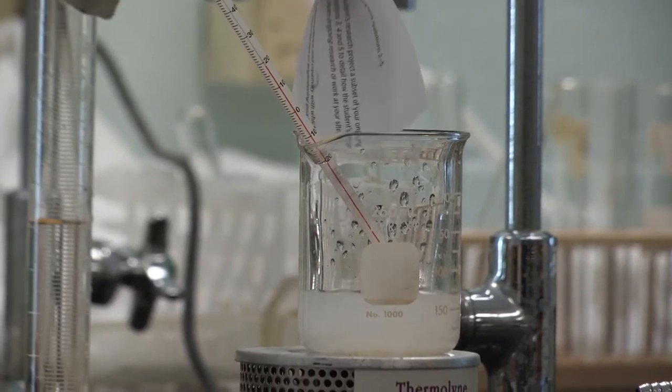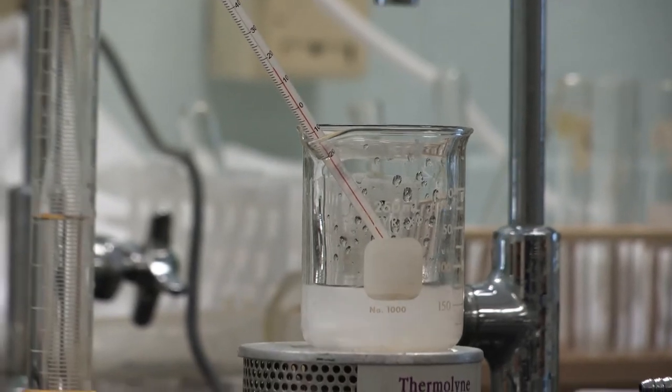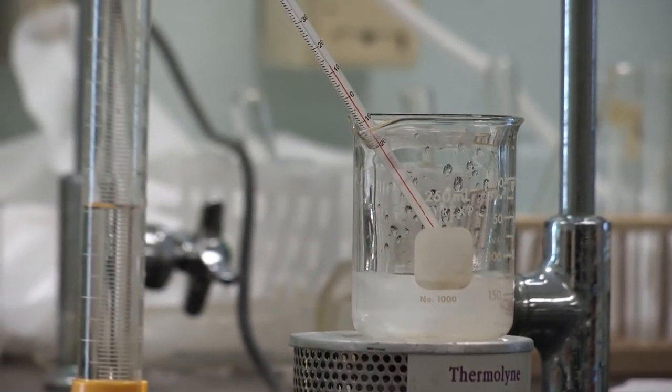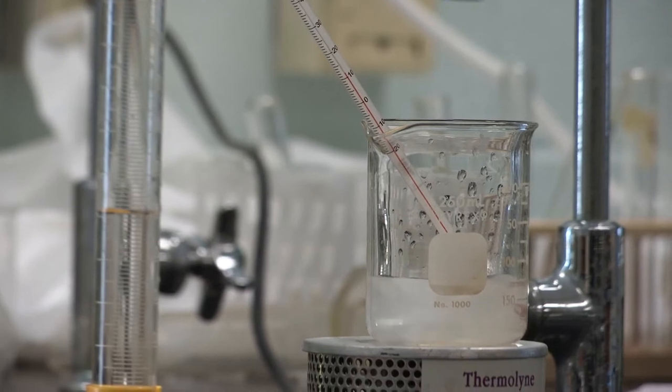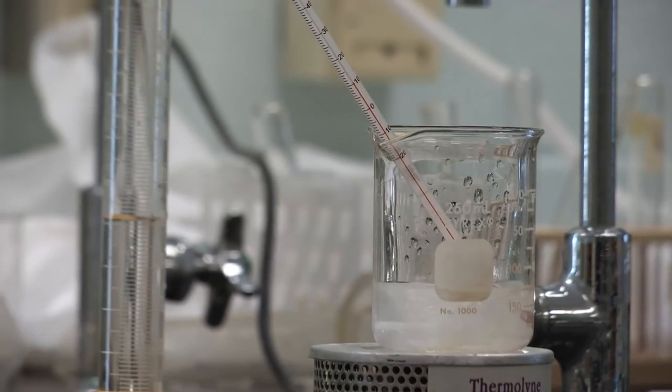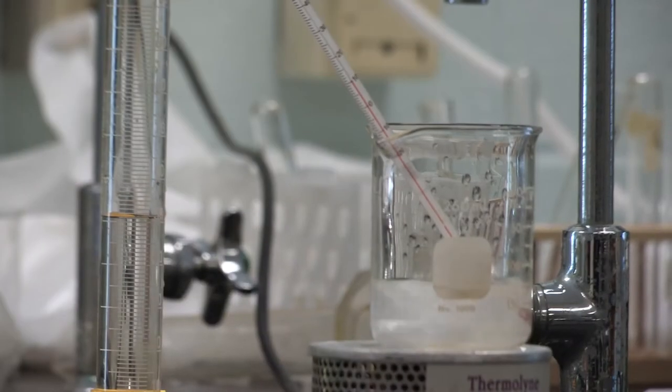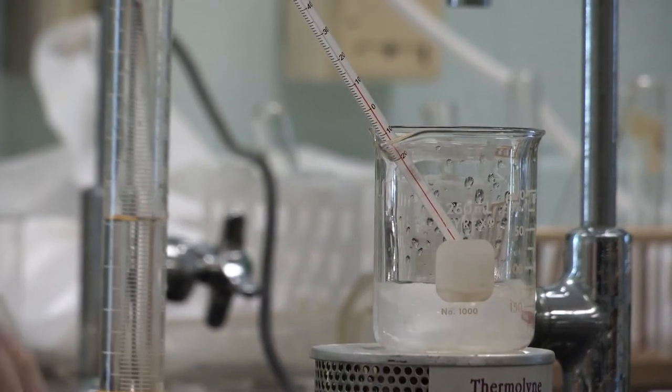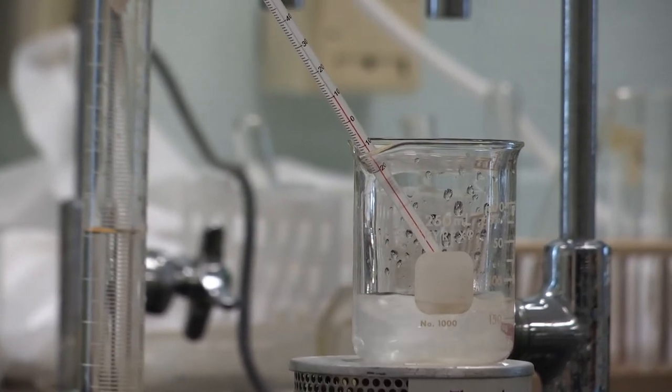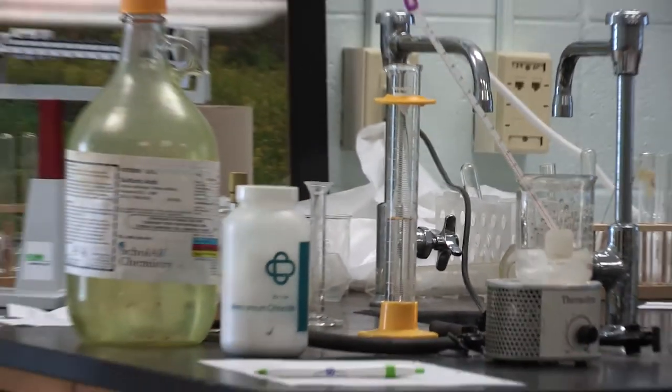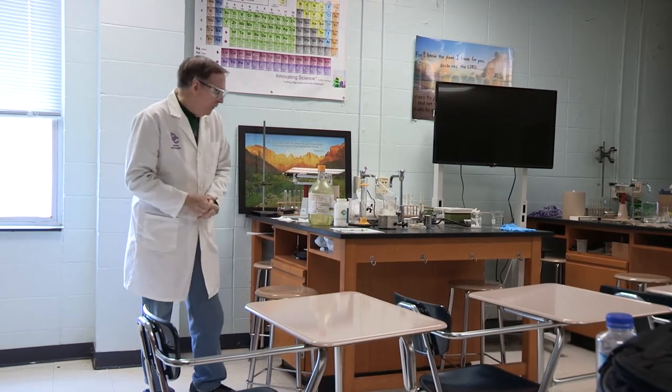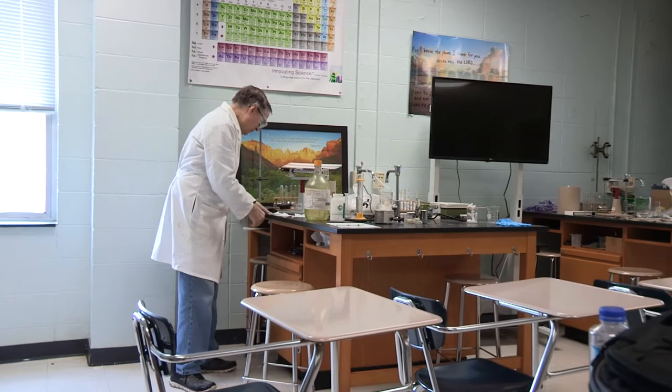As I'm increasing it, can you see any change in temperature? What's happening to the temperature? Can you see a change? Going up or going down? It's going down. I'm going to call that 9 degrees. We started out at 23 degrees. I added 10 grams. And wow, how many degrees did it change? 14 degrees.